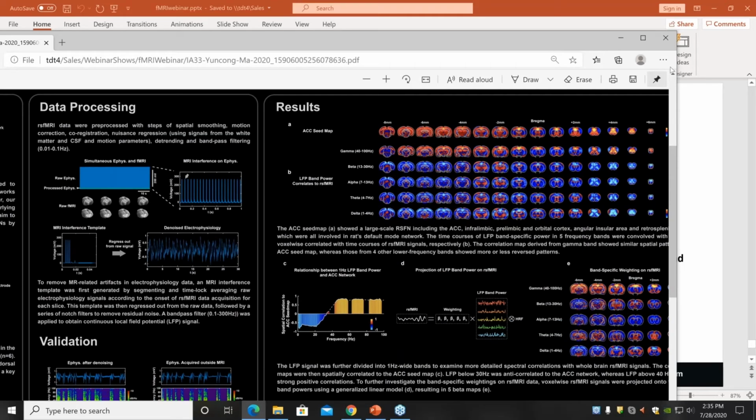Okay, cool, thank you. So on the right top, we get the ACC seed map, which shows the whole brain correlation to the ACC area. And based on the traditional analysis, we separate the LFP signal into 5 bands from the lowest delta to the highest gamma powers, and use them to compute the band-specific correlation to the whole brain resting state fMRI signal. It shows that the gamma band is positively correlated to the resting state fMRI, and the other 4 bands show negative correlation, which has also been reported in previous literature.